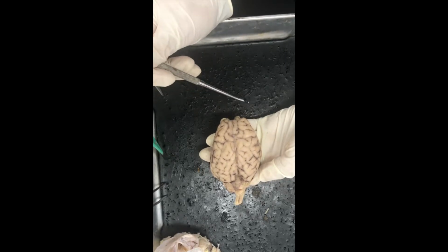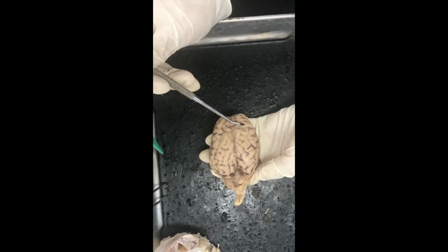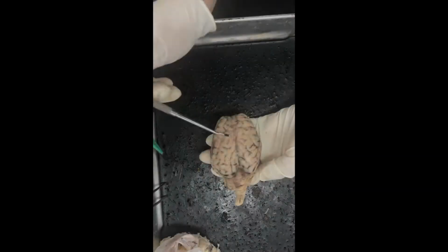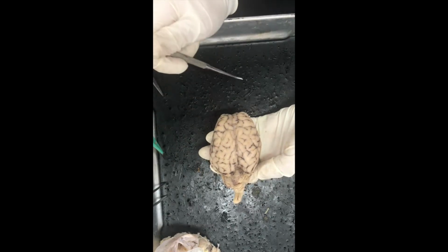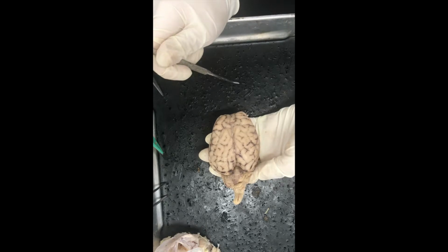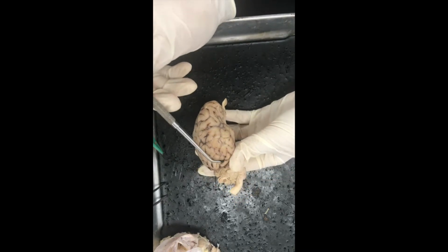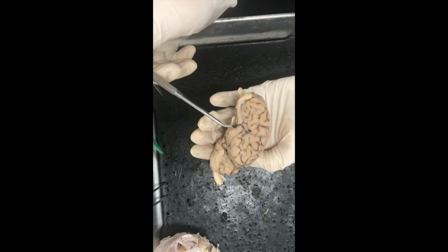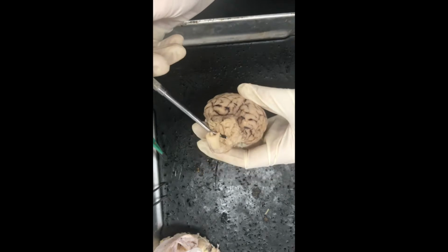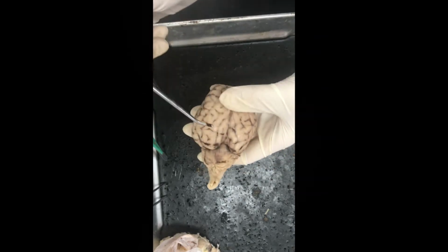So the first one, more anterior of the brain, is the frontal lobe, and that controls muscle control, coordination, and conscious thought. Next we have the parietal lobes, which is helpful with perception, orientation, and taste. The temporal lobes are located on the lateral side of the brain. They assist in auditory, speech, and memory analysis. Towards the brainstem, you have the occipital lobes, and those help with visual processing.